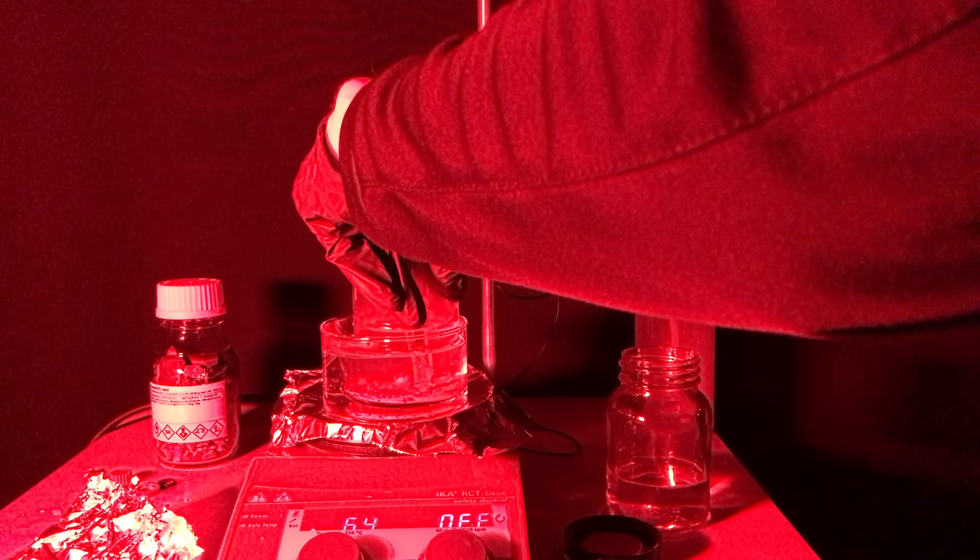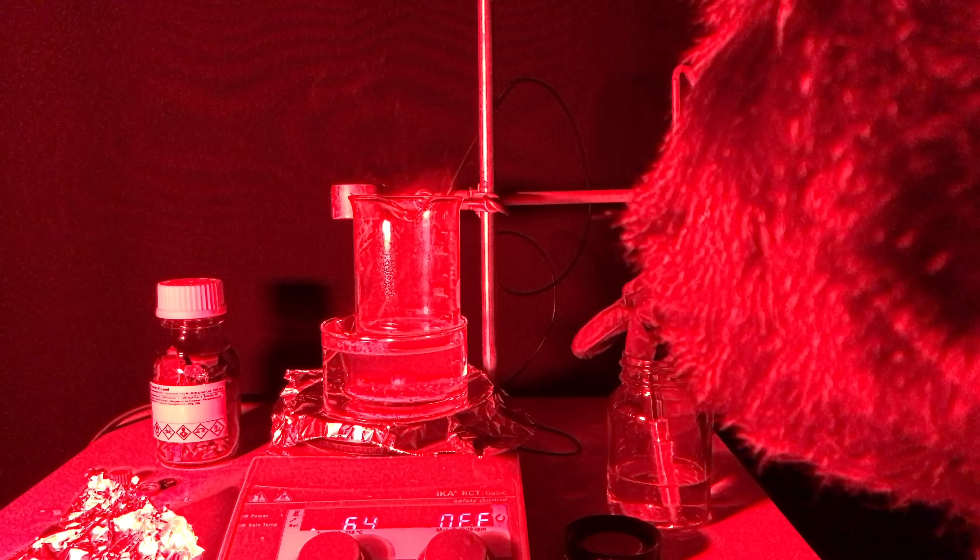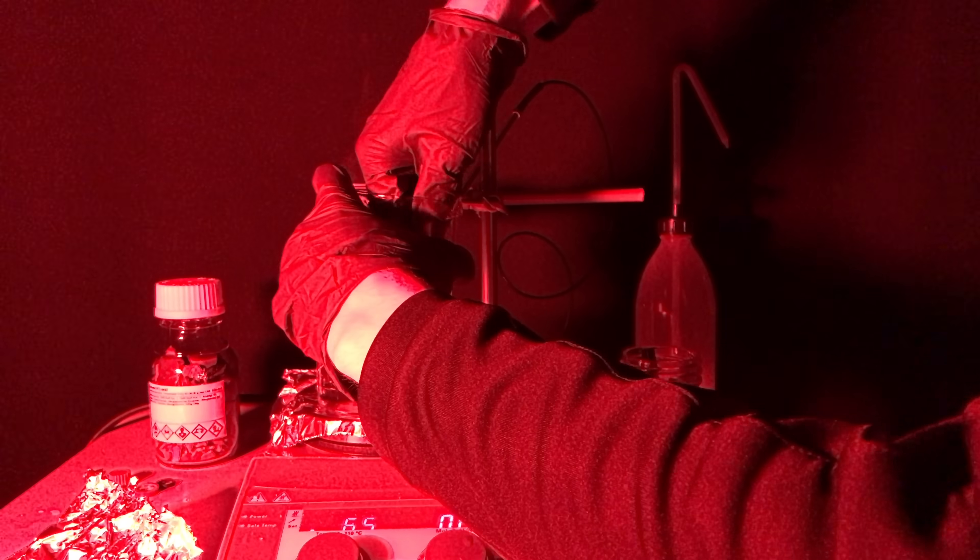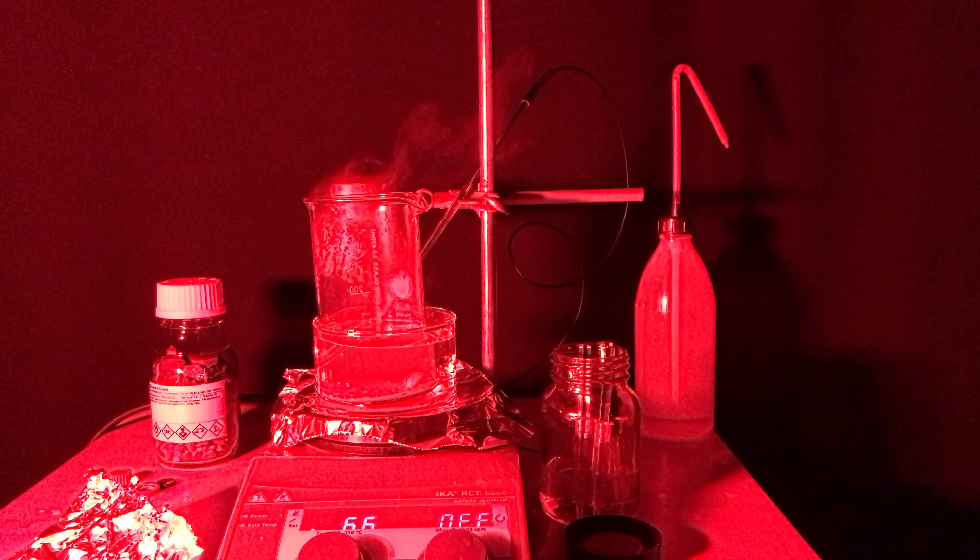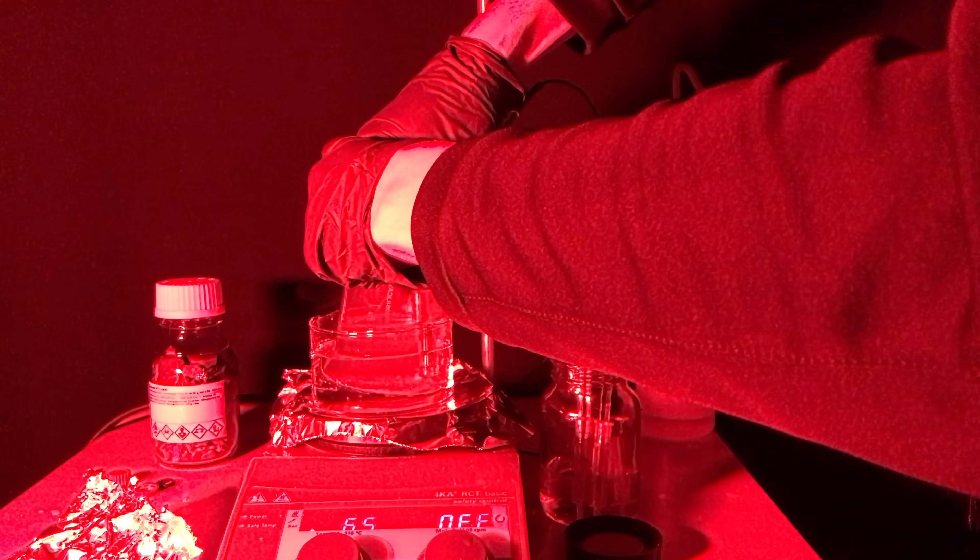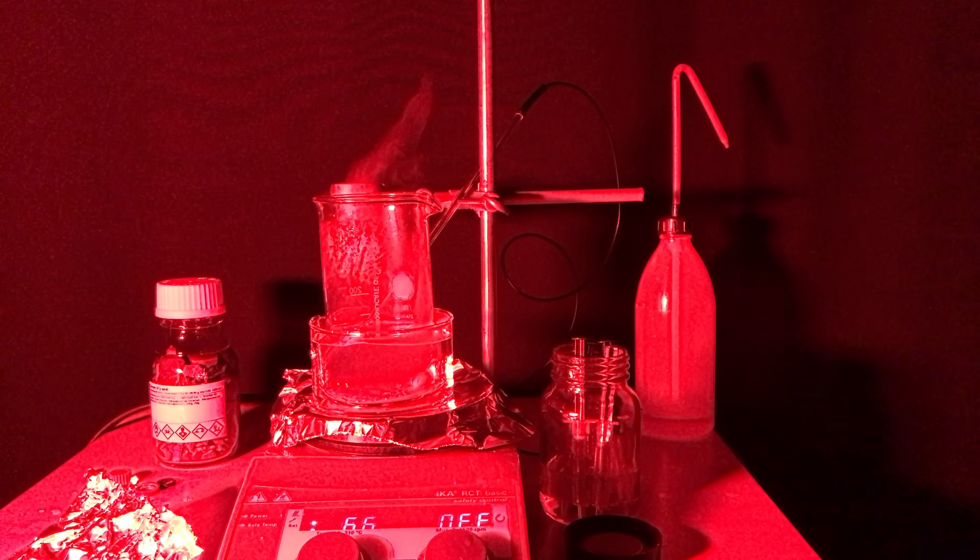For better handling and for aesthetic reasons, I wanted to have my white phosphorus in the form of some sticks and therefore the molten white phosphorus was sucked up into some syringes and put into a glass of water to solidify. Unfortunately I did not film it, but the white phosphorus was actually clear while molten.